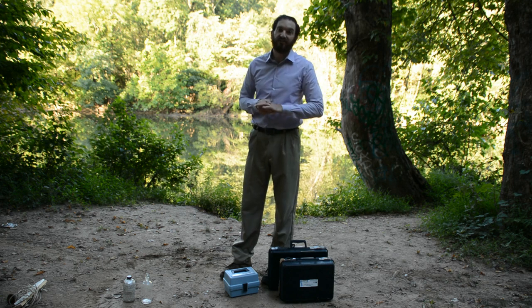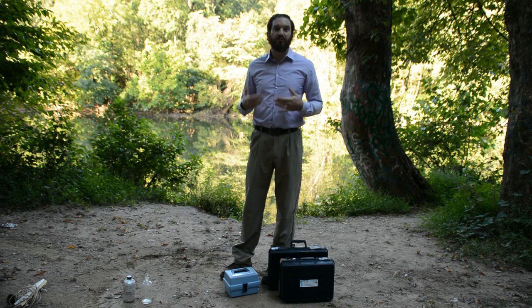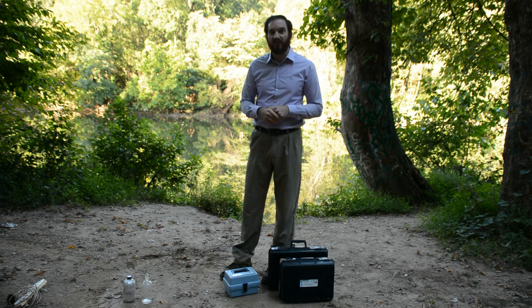I'm going to show you guys how to set up the Google Sheet, so it's going to really do the formulas for us. It's really not like it's extra math, it's just extra work on my end collecting the data. So here we go, we're going to get started, and I'll kind of videotape along the way to see what all we get.